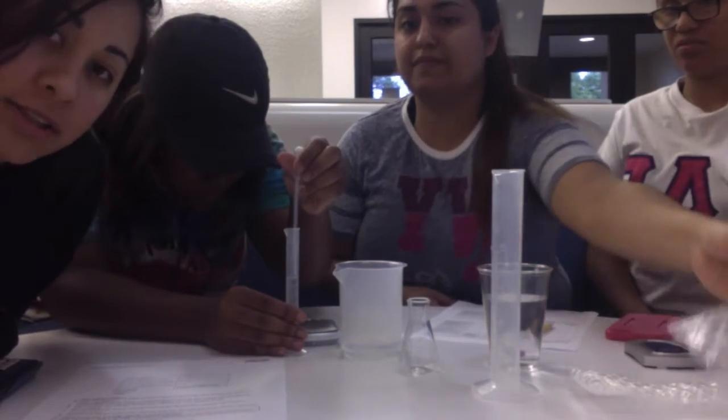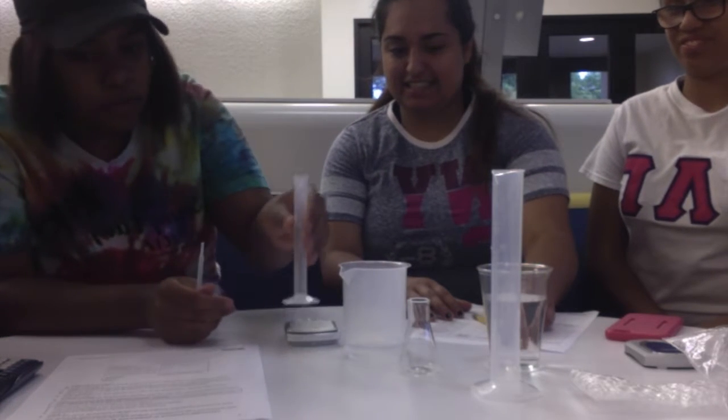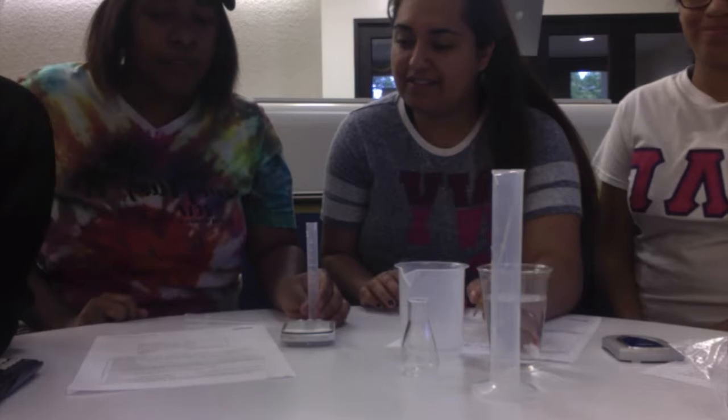Work in progress. Then we're going to record the volume. Activity 2 to be continued.